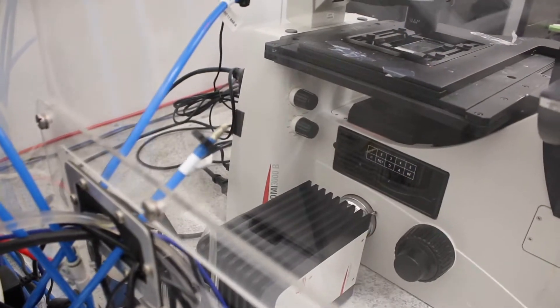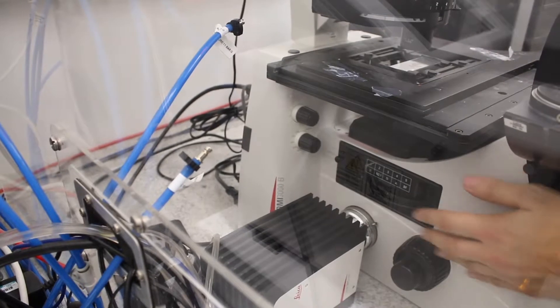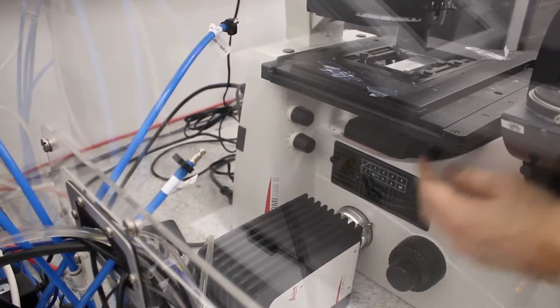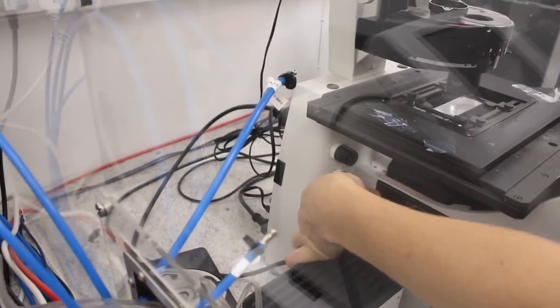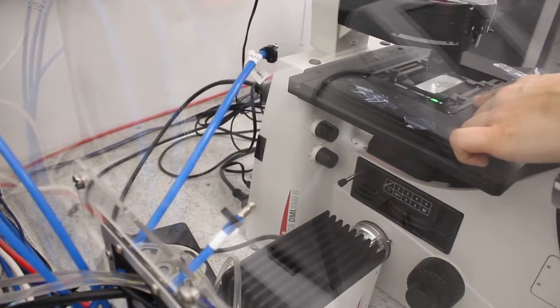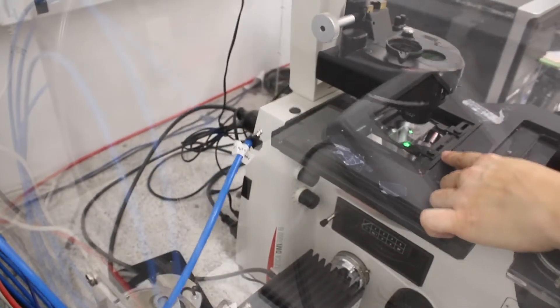And then you need to open the shutter so that the light really goes to the sample. So you have to pull that out, and then you see the fluorescence going out to the sample.